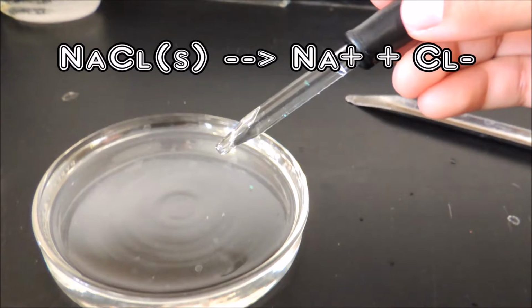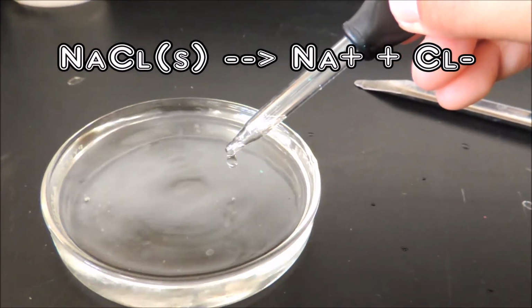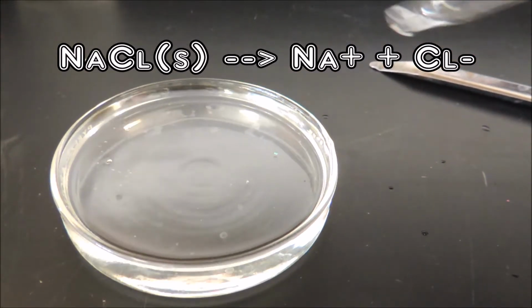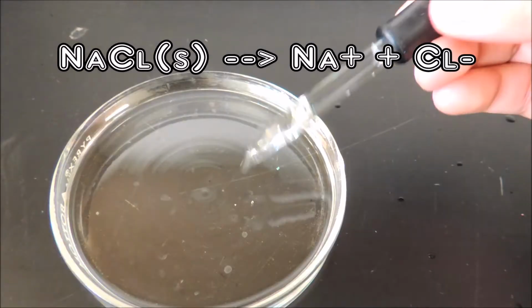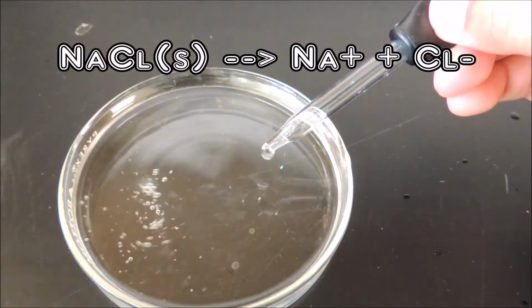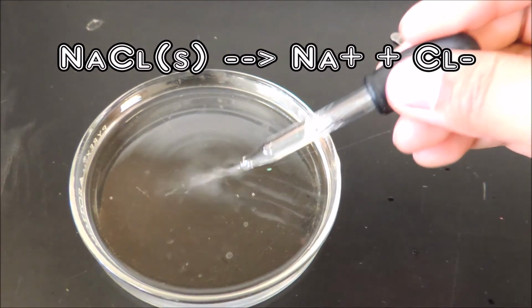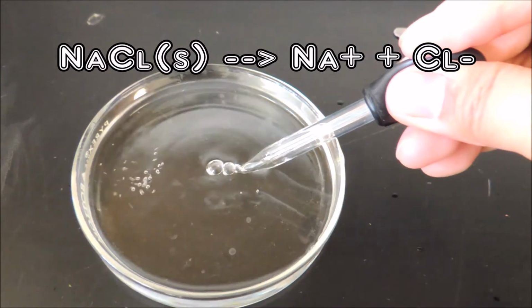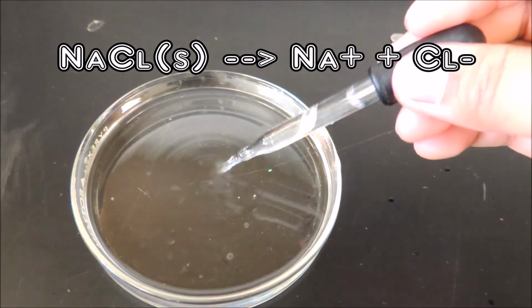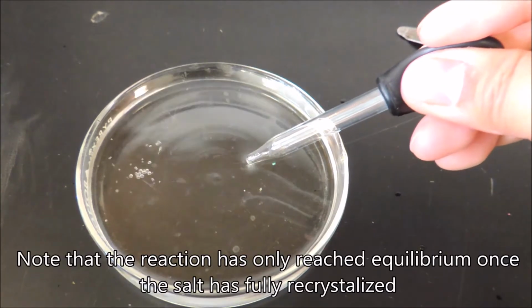This reaction is an example of Le Chatelier's principle because adding salt to water creates two aqueous solutions, which are sodium and chlorine. This reaction favors the product side, which shifts to the right. The hydrochloric acid is used to reverse the reaction. The reverse reaction occurs when more concentration of chlorine is added. This reaction favors the reactant side, which shifts to the left. This creates the salt to crystallize again. Therefore, this reaction is at equilibrium.